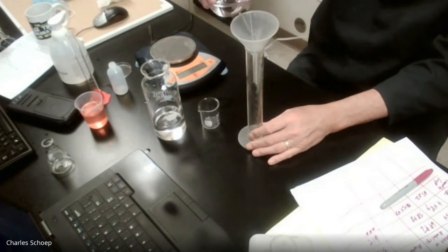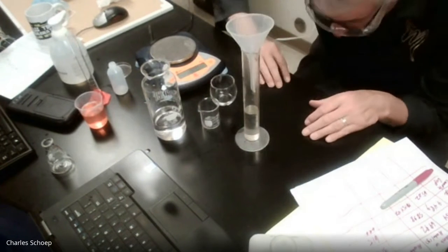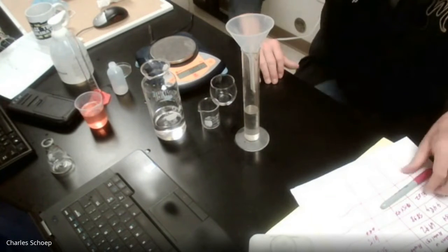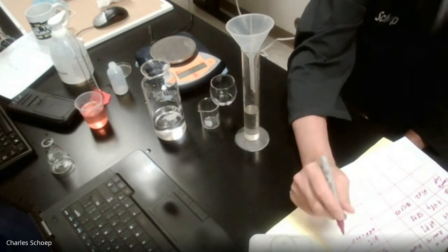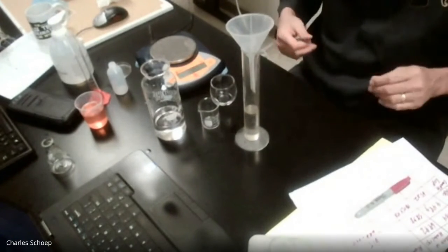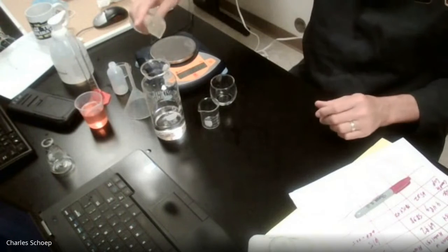And 43.5. So 68.0 plus 43.5. All righty. And then you go there.